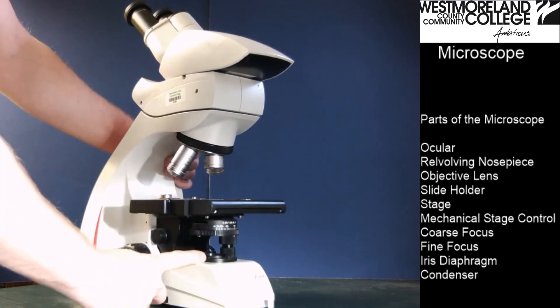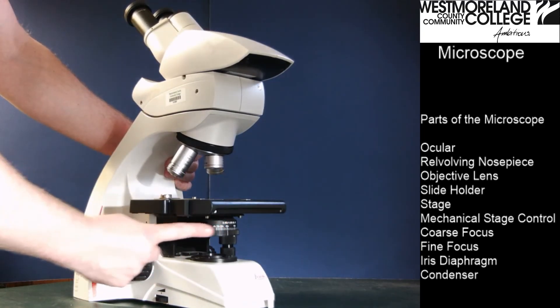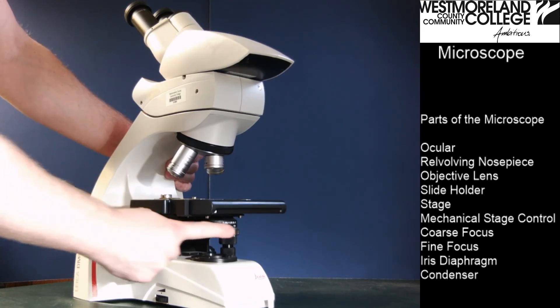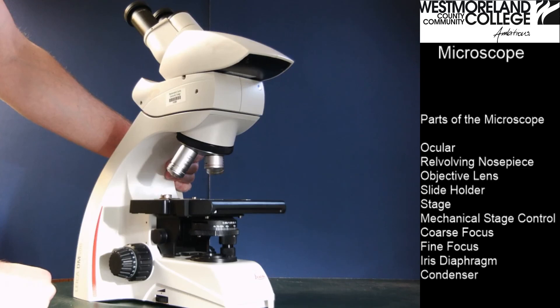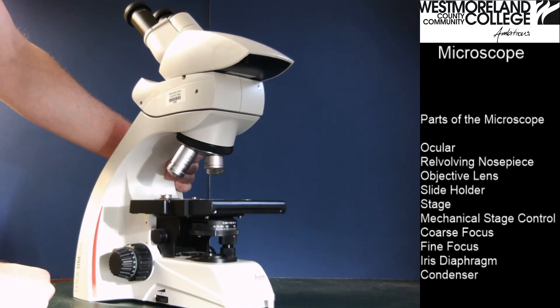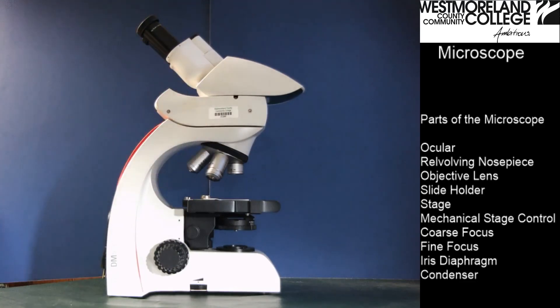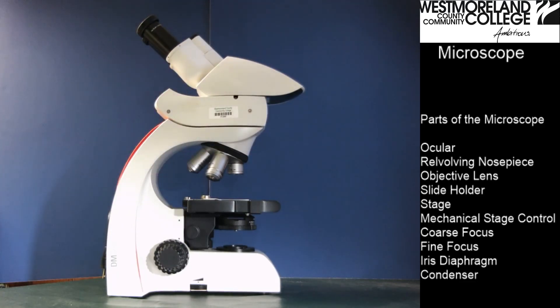Where the light comes out, we have the condenser and the iris diaphragm, which moves to open or close and let more or less light up through the lens. Those are the basic structures and parts of the microscope.